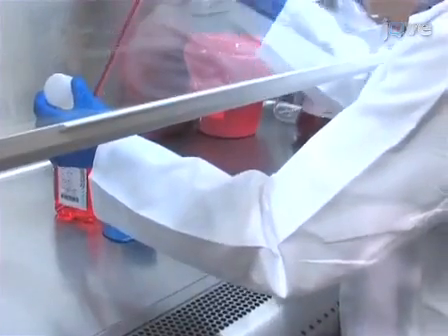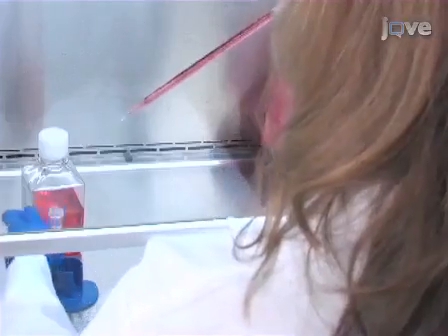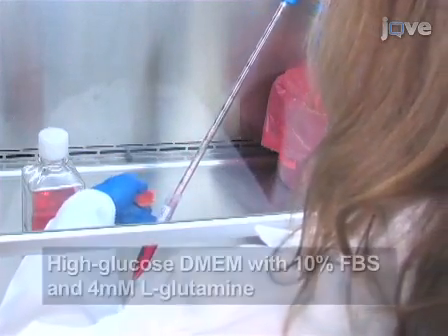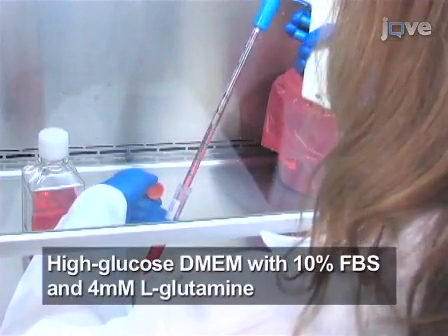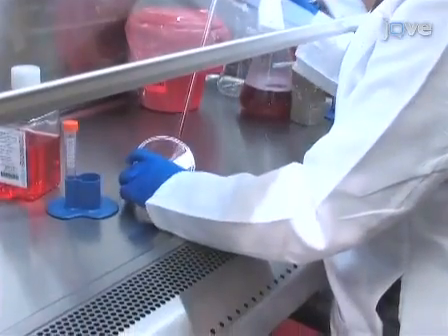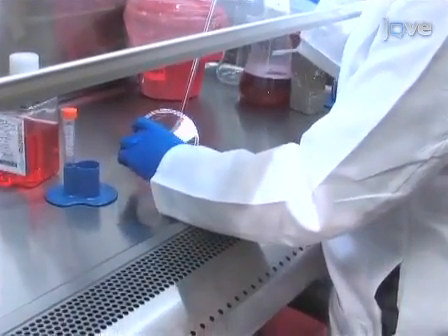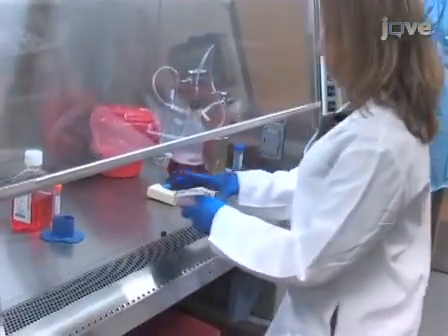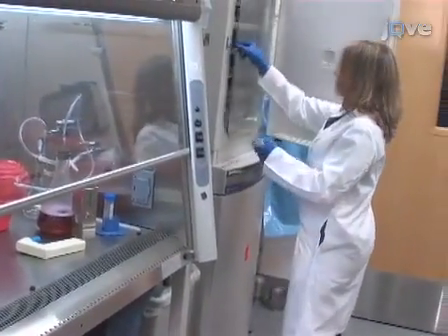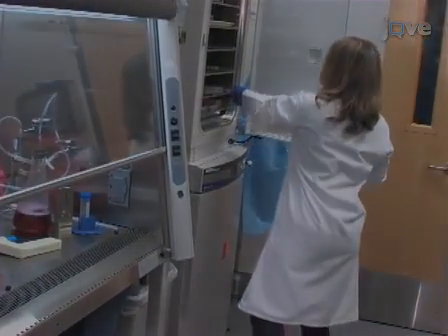Working in a tissue culture hood under aseptic conditions, resuspend 5 × 10⁶ 293 T cells in 10 ml of antibiotic-free 293 T medium. Pipette the cell suspension into a 10 cm tissue culture plate and incubate the plate overnight in a tissue culture incubator at 37 degrees Celsius and 5% carbon dioxide.